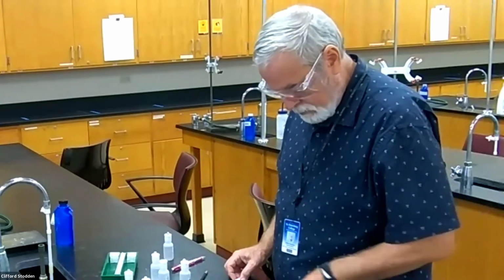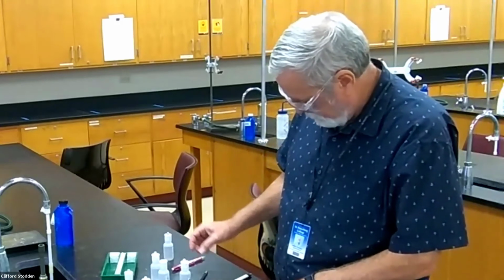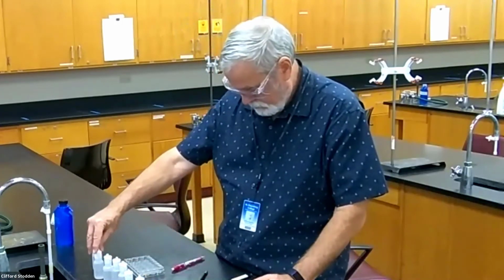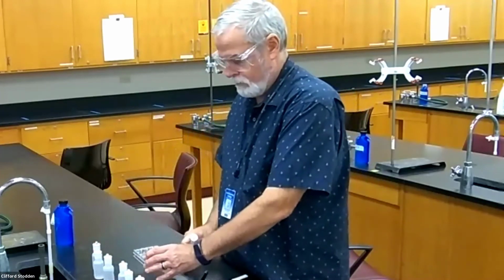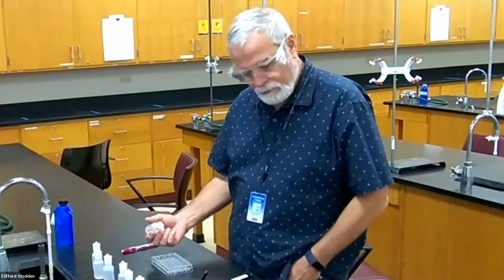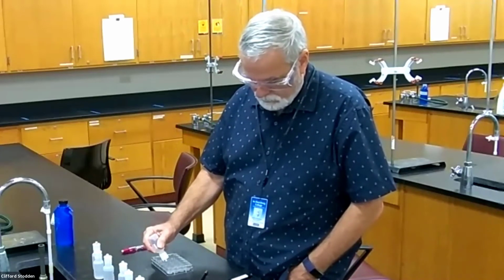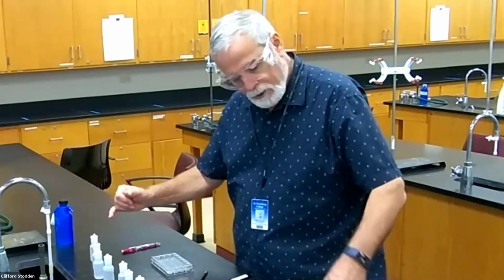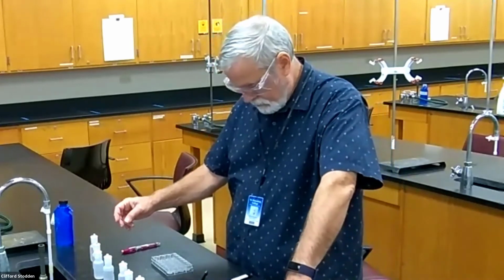Hydrochloric acid, and there's 3 to check with that one. So HCl, that one. And I'm going to put that in 3 well plates here, about 10 drops each. And then go to the last 3 here, sulfuric acid.